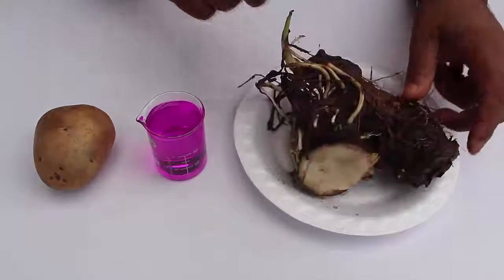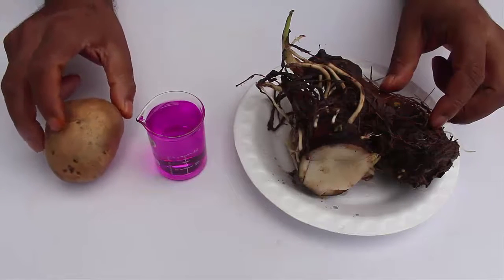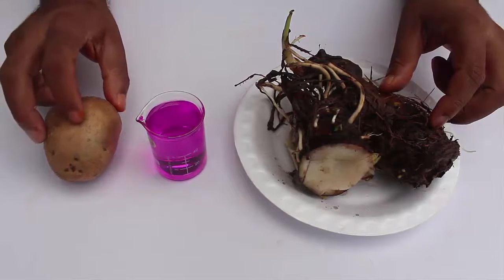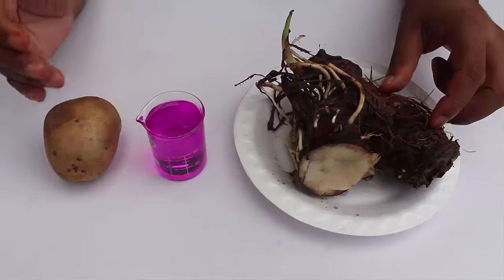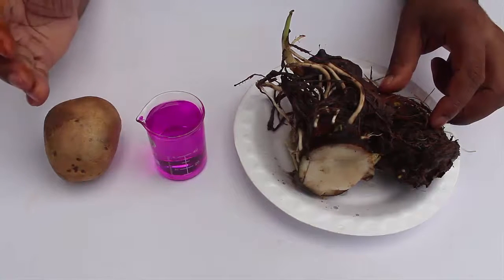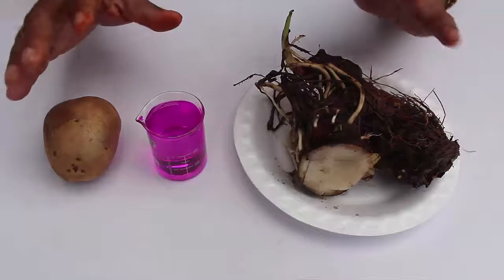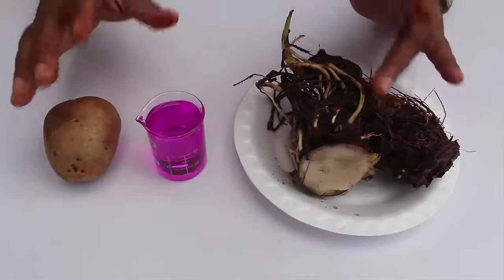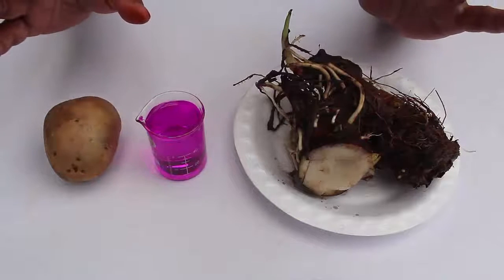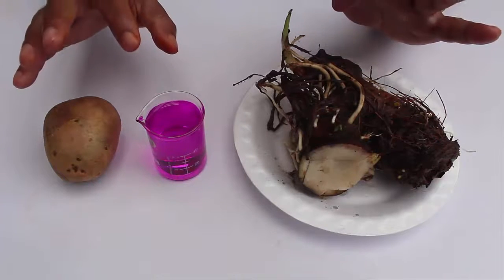Similarly, I cut a piece of the potato and also boiled it in water for 10 minutes, then took a sample of the extract of the boiled potato.